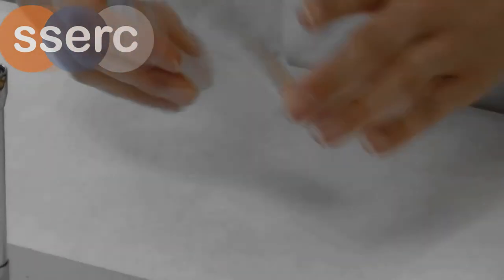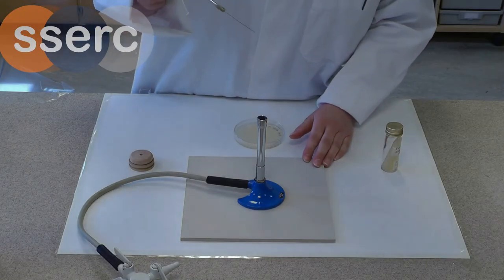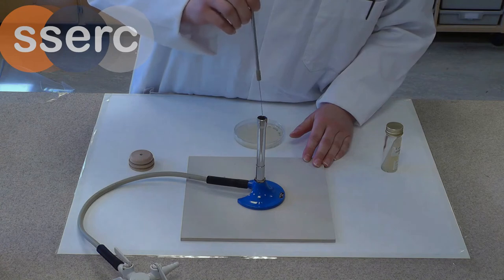Turn the plate the right way up, work within 20cm radius of your flame and the first thing you have to do is flame the loop.